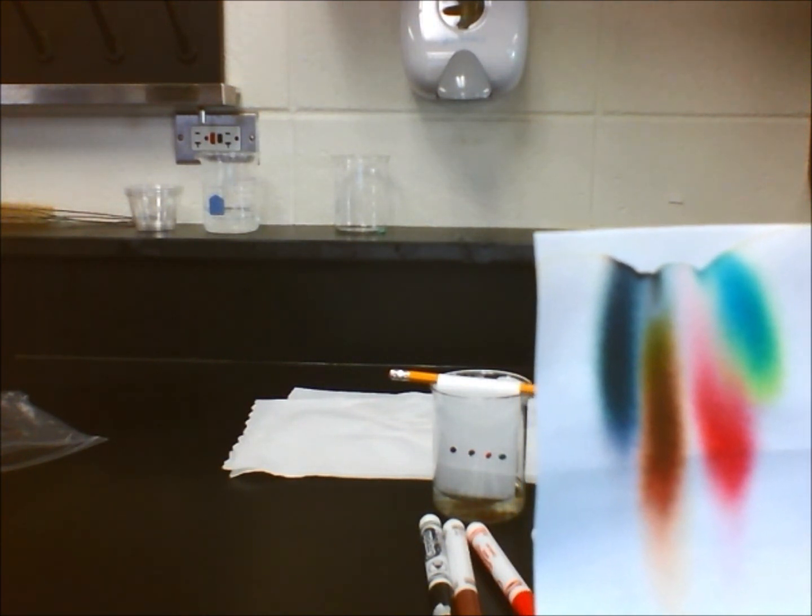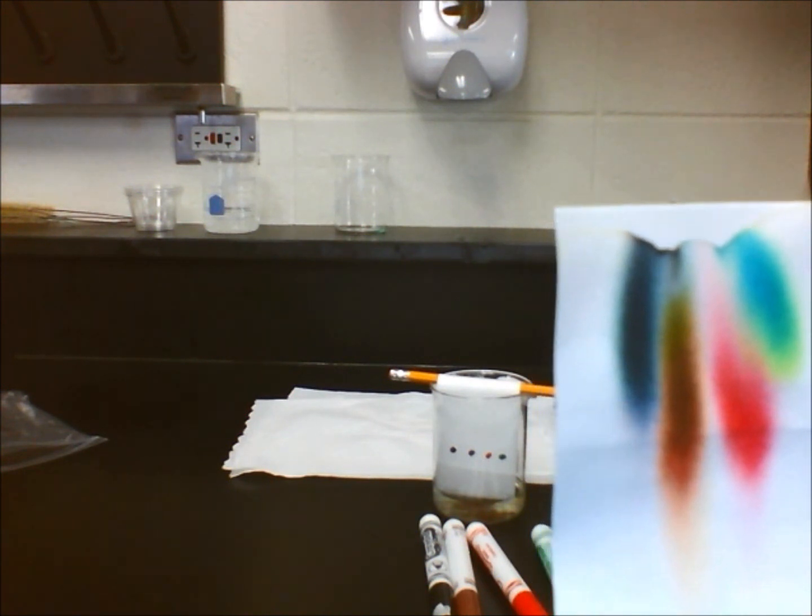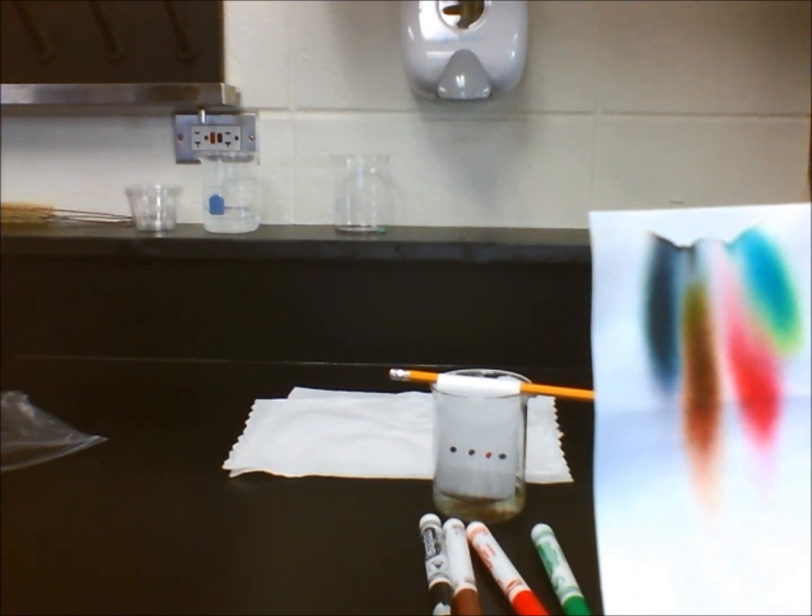Some red dyes, like in a red Sharpie, might not move at all. Therefore, we can conclude that different dyes will have different solubility rates, even if they are the same color.